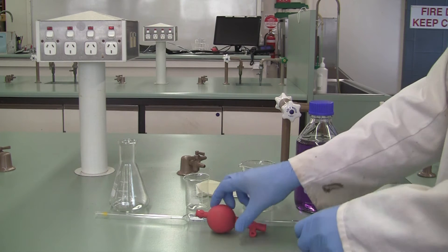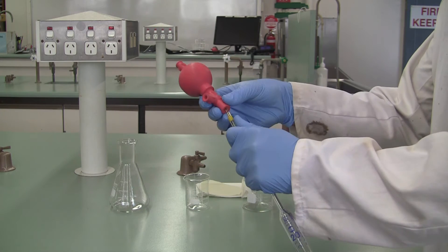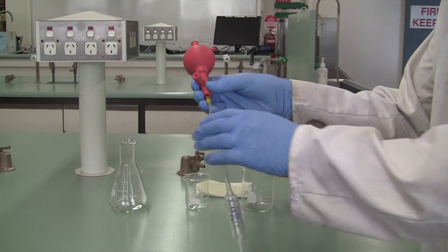Instead, you can see here when we pick it up, hold the pipette nice and high up the top, and then just ease your safety bulb on, like so.